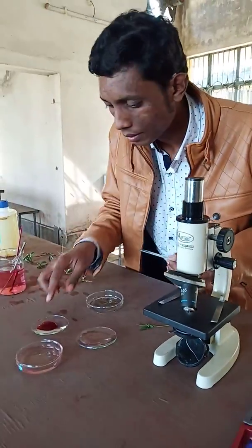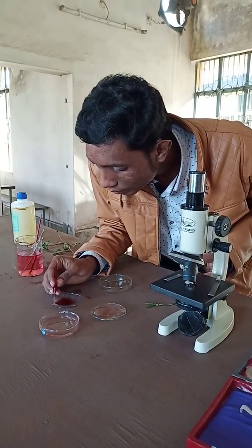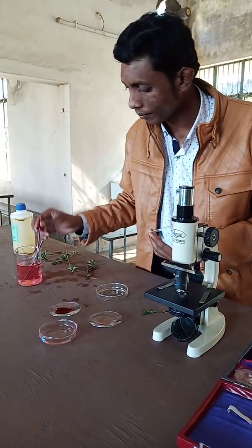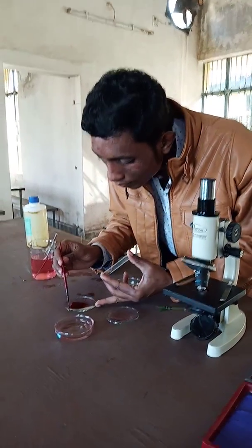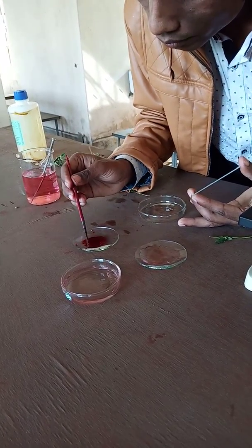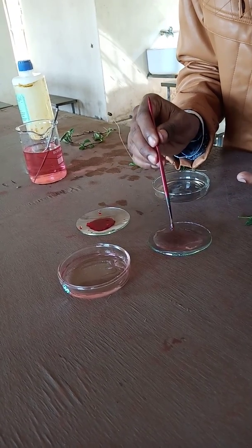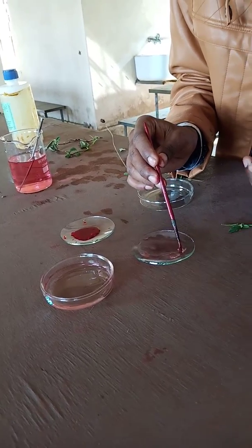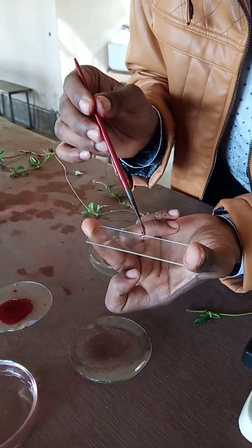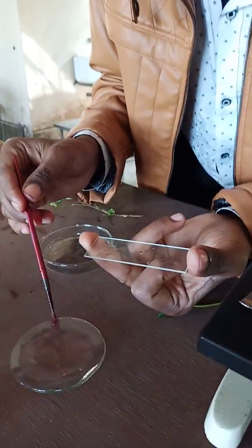Here you can see three thin sections — the transverse sections of the stem. Now take this transverse section and put it again in water. After staining, we put it in water, then take out the stained section and put it on the slide like this. Here we have the slide with the specimen taken.